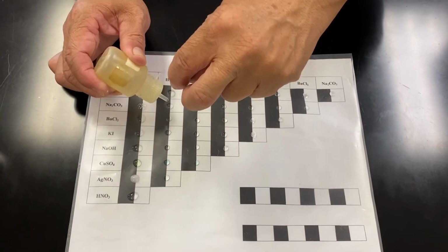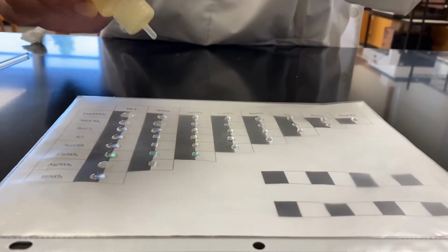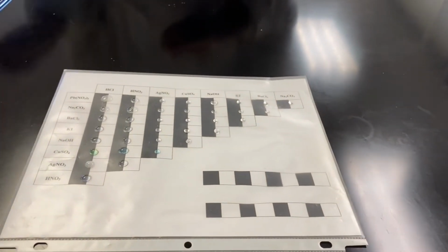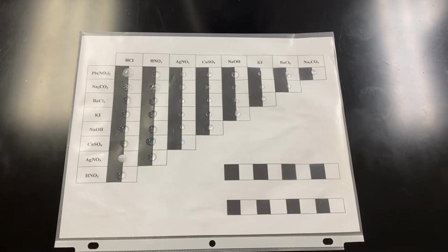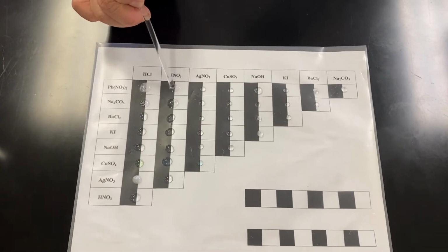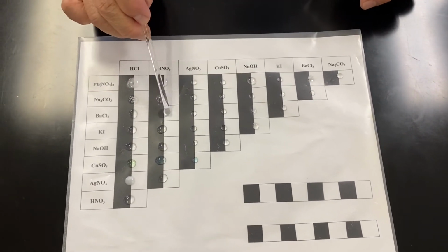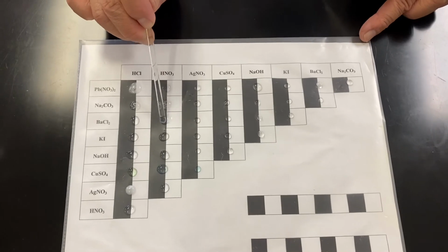One drop. Also, all the bubbles have formed. Beautiful. Okay, so now we're going to do exactly the same thing. Stir, clean. Okay, nothing happens. Bubbles formed. 3 times one direction, 3 times another direction.